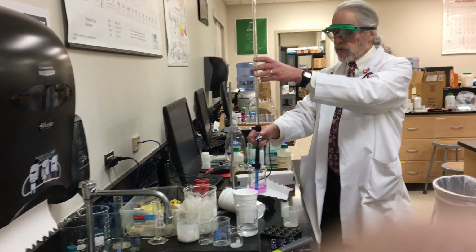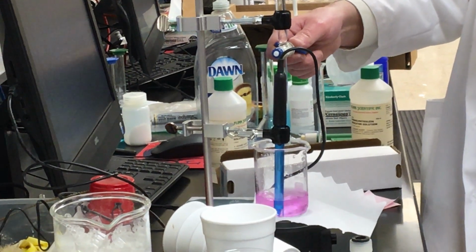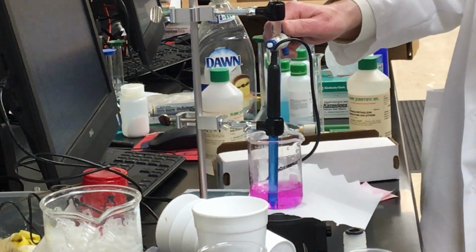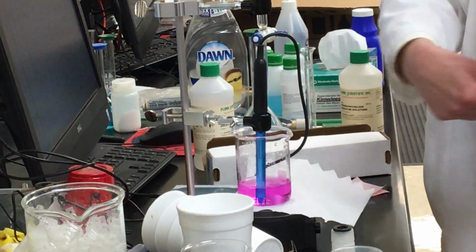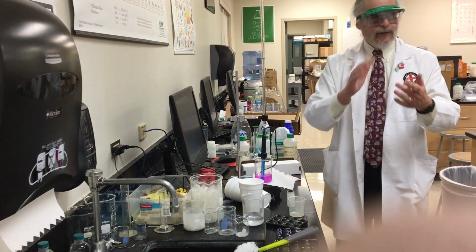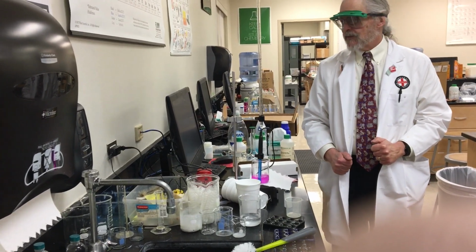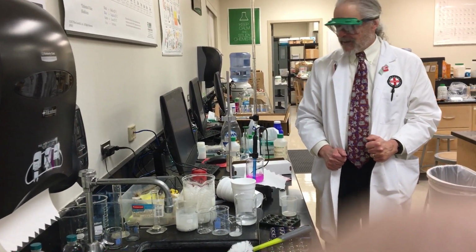Now, what happens if you go too far? You see that nice pale pink color? Notice that color is different. Pretty dark. When you get to that, you went too far. What can you do? Dump and start over. Dump it all and start all over again.